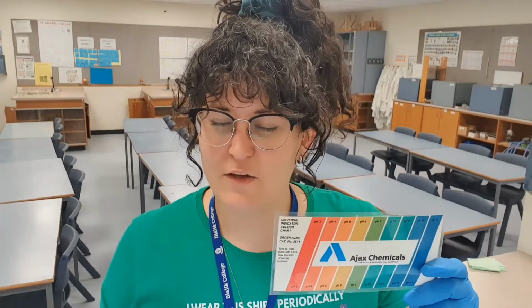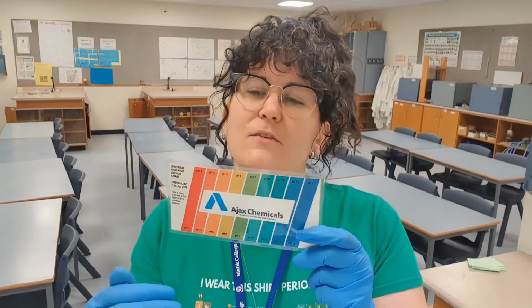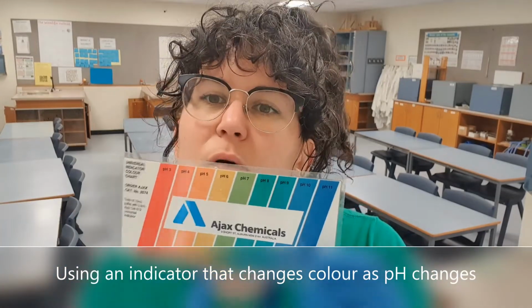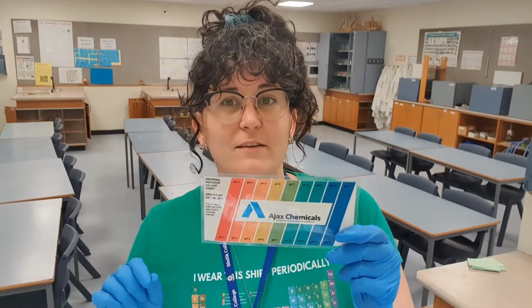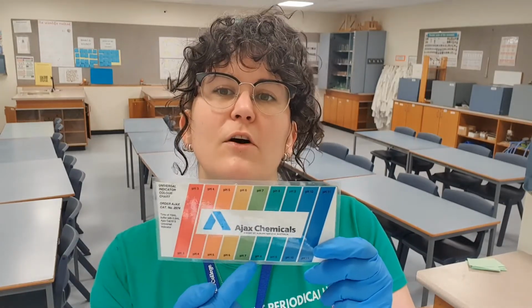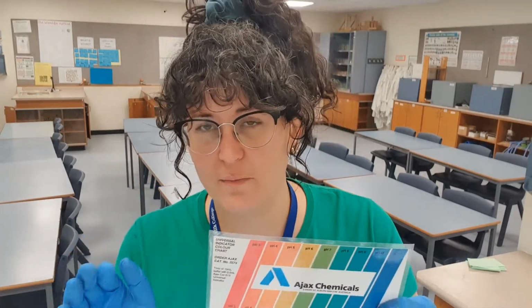Now this is important because when we break down the fat in milk, it turns into fatty acids. And because it's acids, that means the pH is going to go lower as the fat in the milk breaks down. So we'll measure the pH of milk. It's probably around neutral, in the middle, so about 7, 6. And then as we add the enzyme to the milk, theoretically, as it breaks down the fat into fatty acids, we should see the pH slowly drop. So basically, we're going to measure the effectiveness of the enzyme by measuring the pH change.